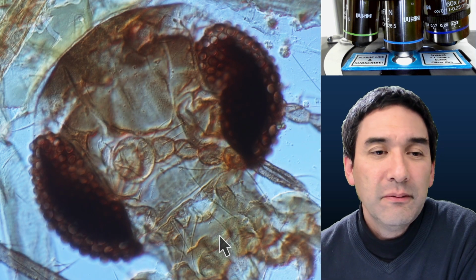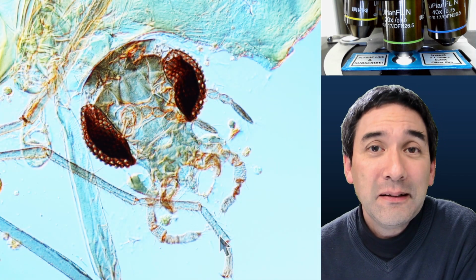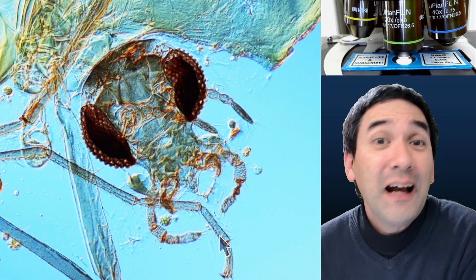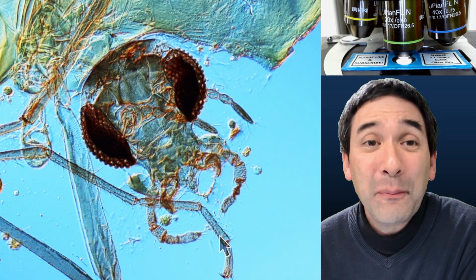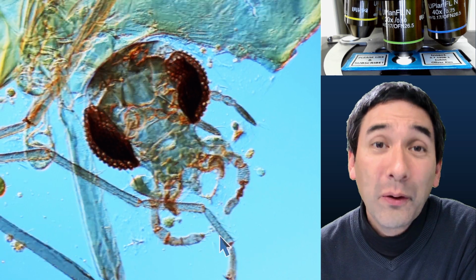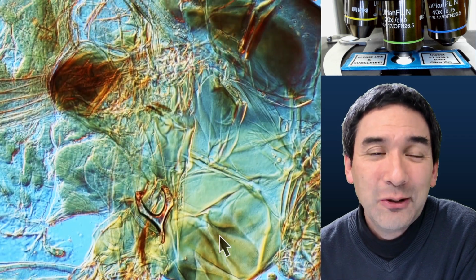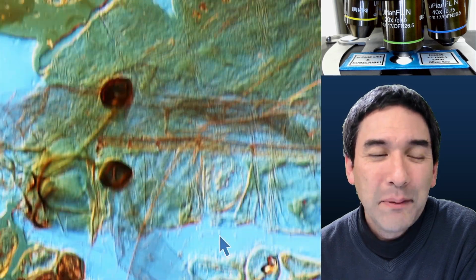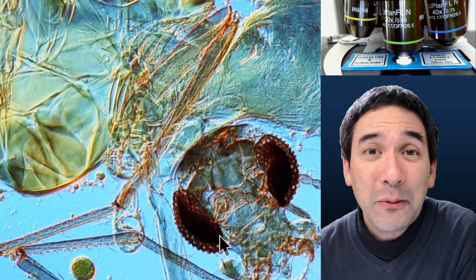And you see that essentially there are a variety of ways in which specimens can be improved. Indeed, the more specimens you mount, the more practice you will gain, as with every activity. And another thing that's important is the more specimens that you mount, the higher the chance that some of them are going to last for a long time, or that they might look very nice, because sometimes it's difficult to arrange those little critters in a way that they look nice under the microscope slide. And sometimes there's a little bit of breaking of the specimen happening, difficult to avoid. But the more specimens that you make, the higher the chance that one of them will be quite usable.